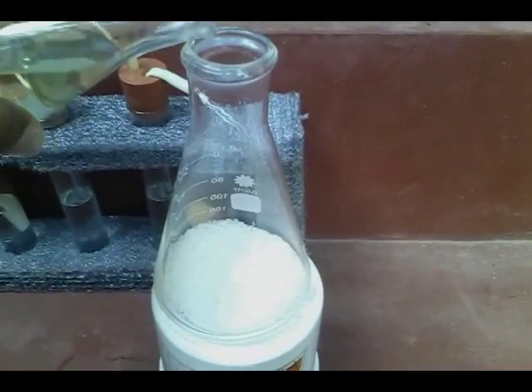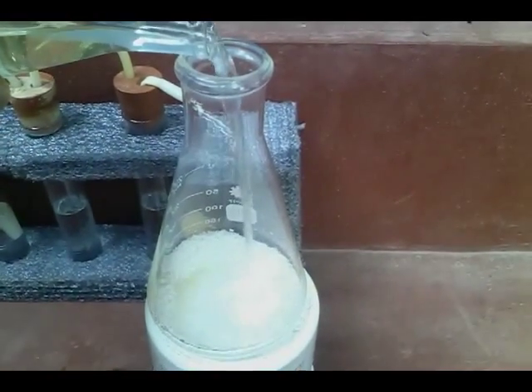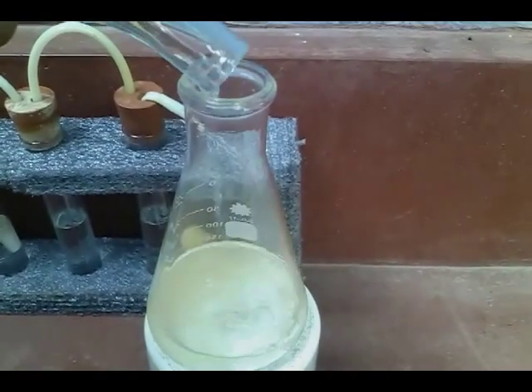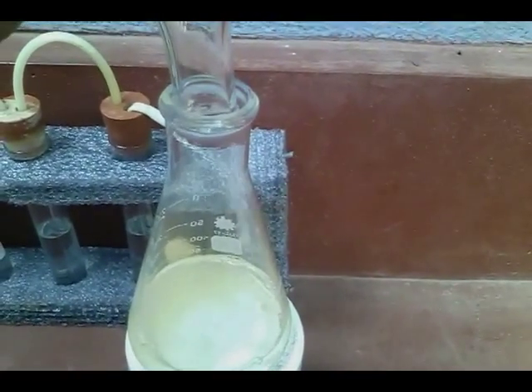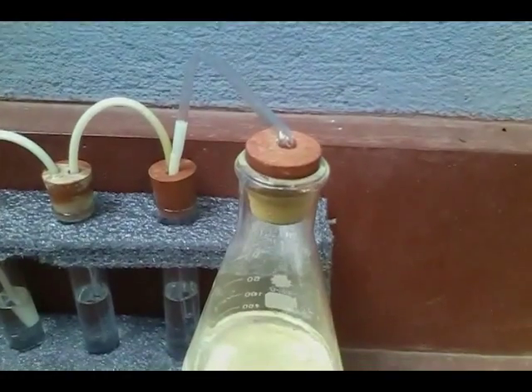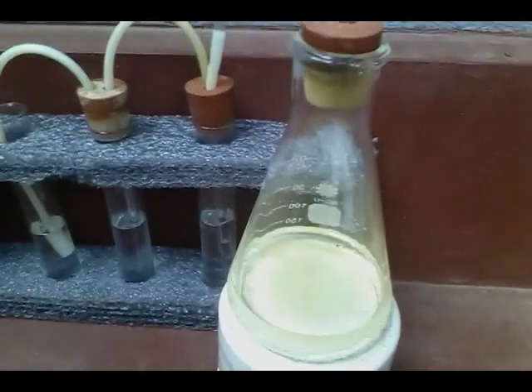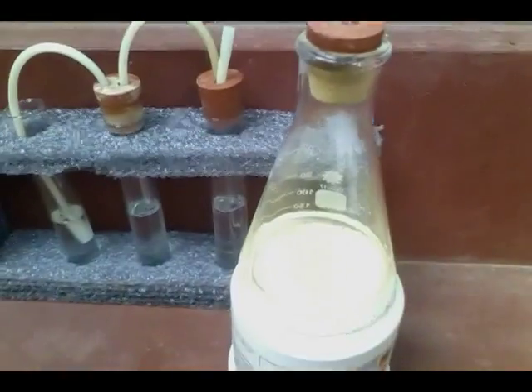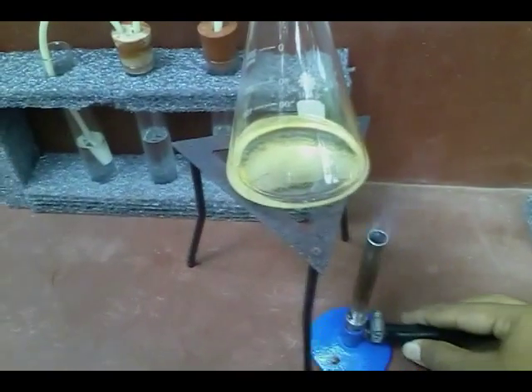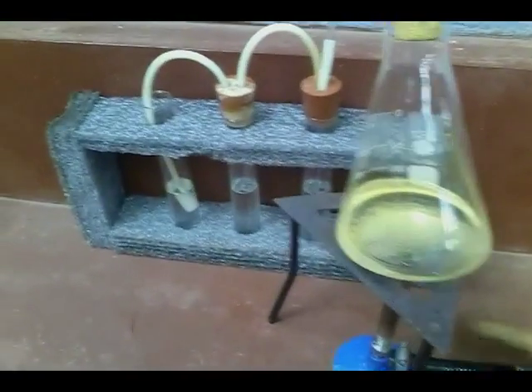Put nitric acid into the sugar to start the reaction.